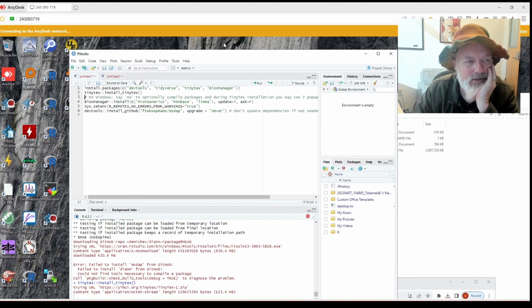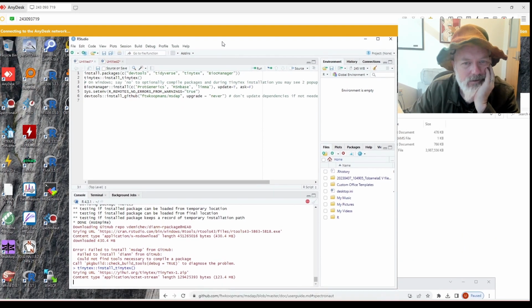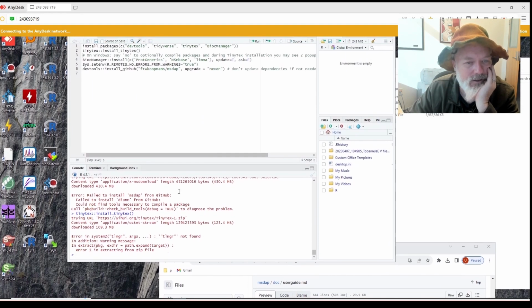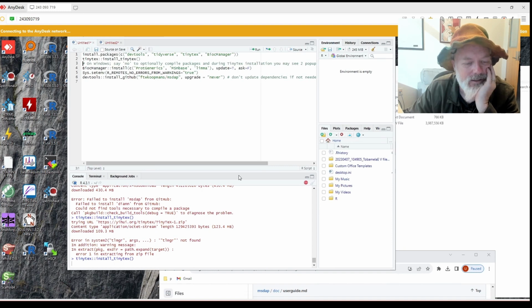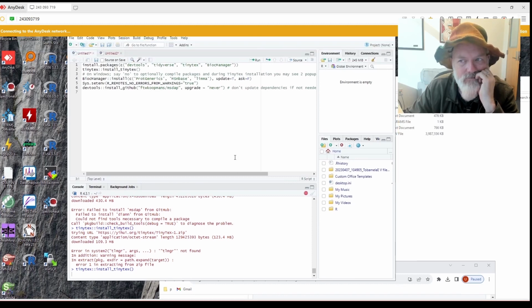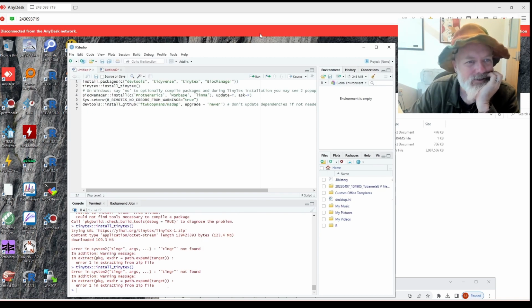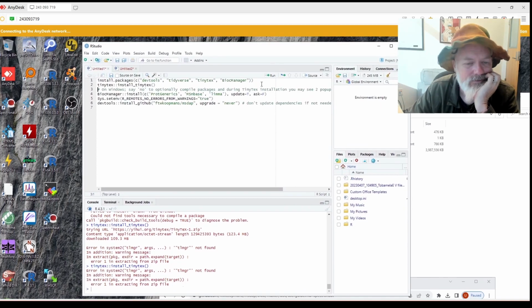Why is my AnyDesk not working? Connecting to AnyDesk network. So let's see. I may have screwed it up by trying to do it again. Let's try this one. This is why I do it one line at a time. Usually that's a better option, but not always. Why is it giving me this more information? I don't actually want more information. I just want this to go away. Oh, now it's red. That's not good. Okay, go away. All right.